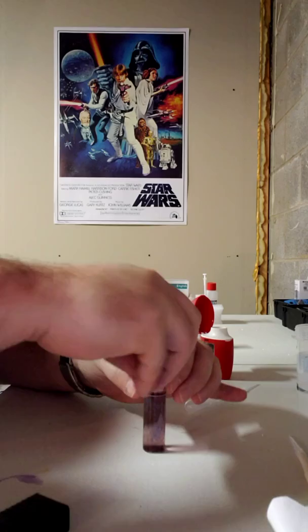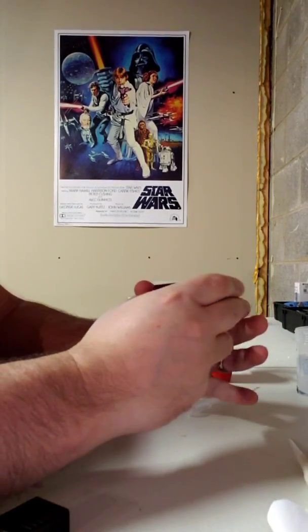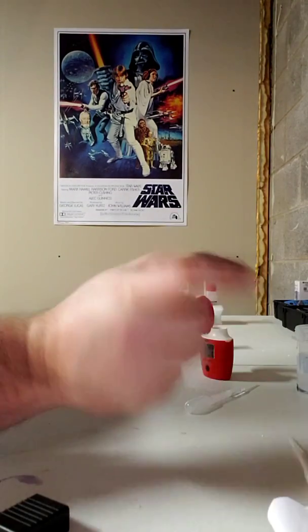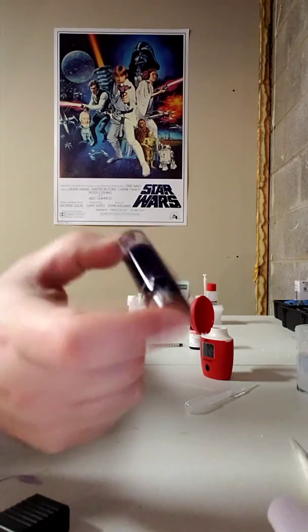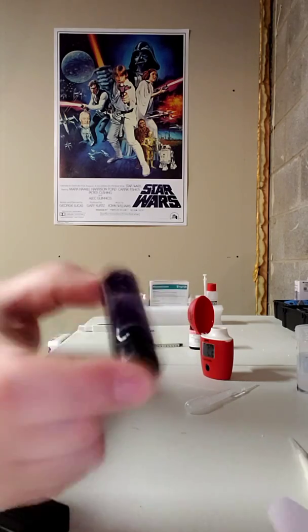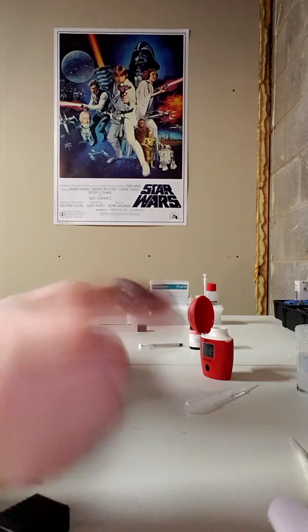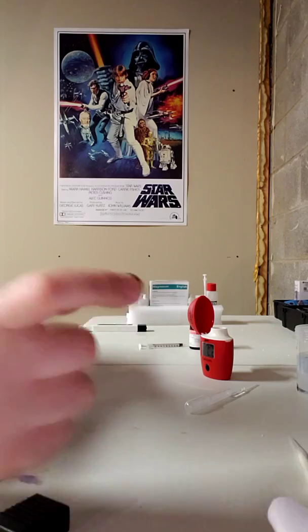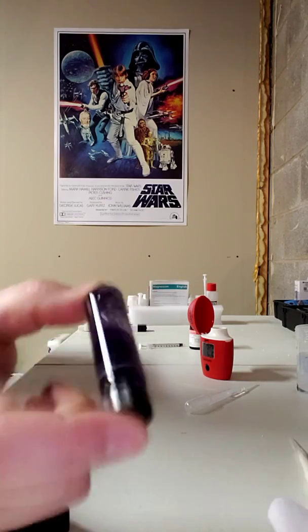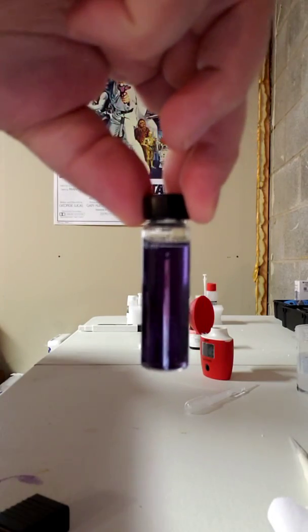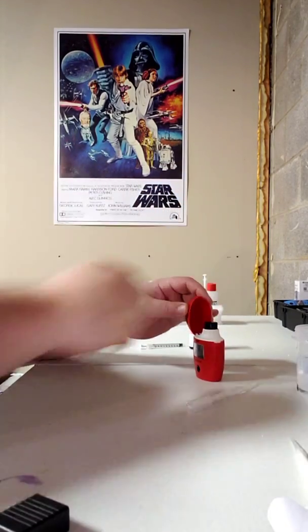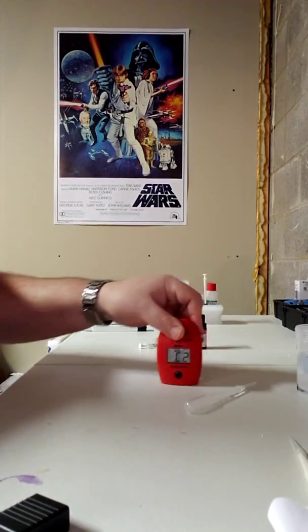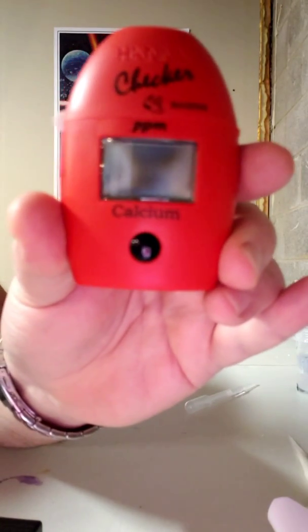I'm going to put the cap back on and the instructions say to shake this for 15 seconds. So we're going to give it a shake for 15 seconds. Lucky me, I can watch the little counter on my clock here with the timer for the video. All right, that's 15 seconds. Now, nice shade of purple. That's a good sign. So now I'm going to place this back into the tester, remembering to put my 10 ml straight forward and click the button. And then what do we get?